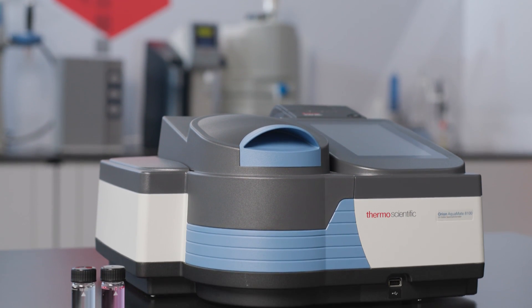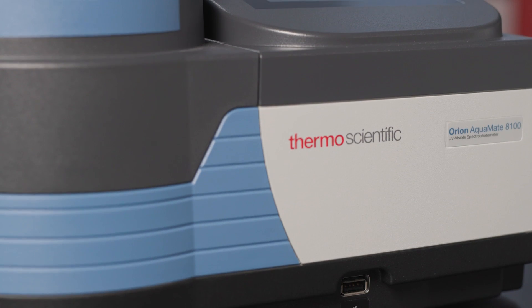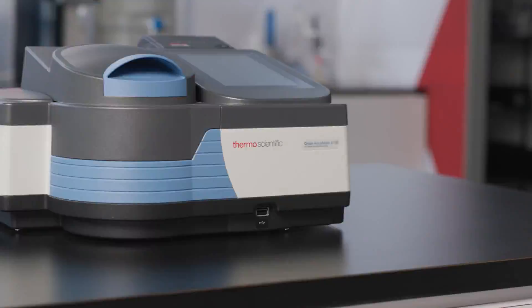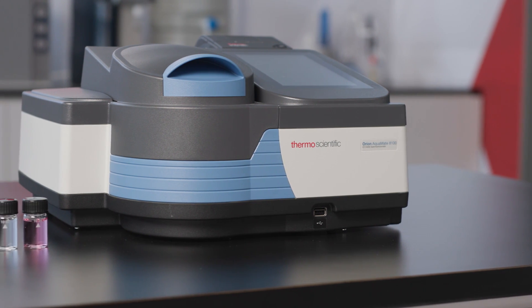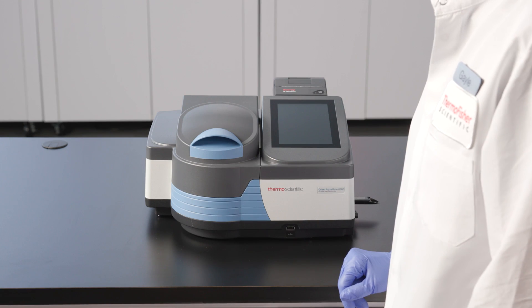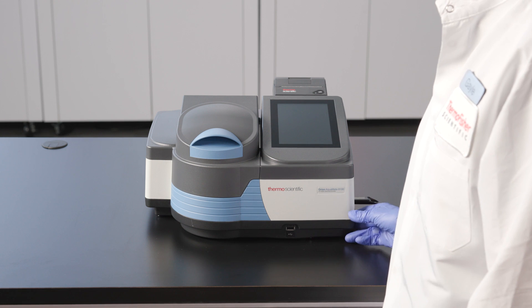Hello, my name is Gail Glykoff. Today I'd like to take a look at our Thermo Scientific Orion Aquamate spectrophotometers. To get started, I'm going to turn the instrument on.